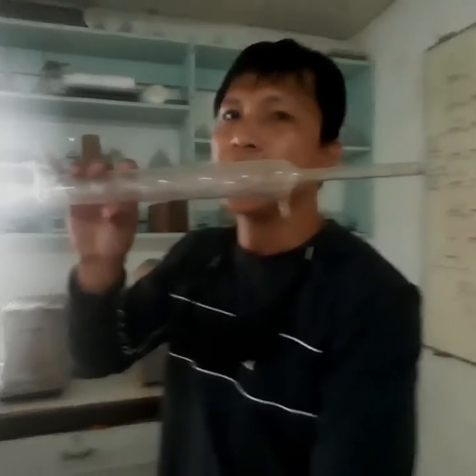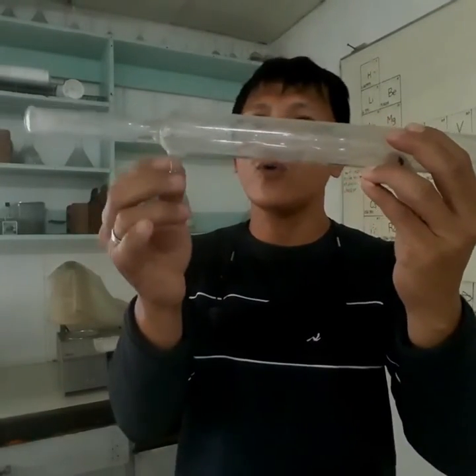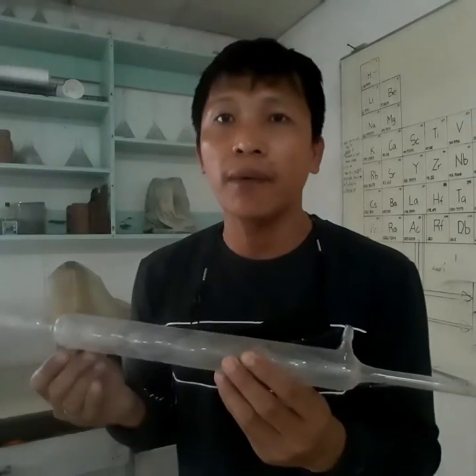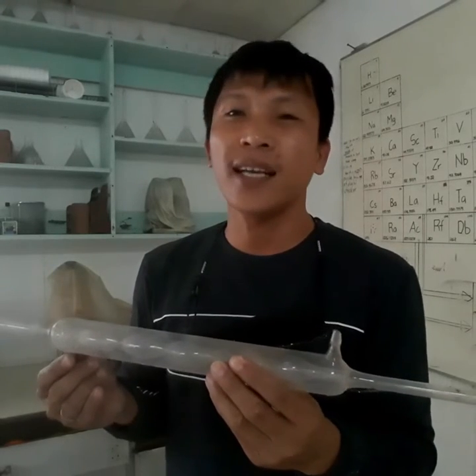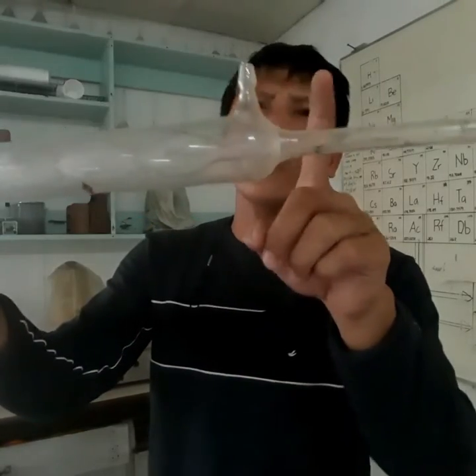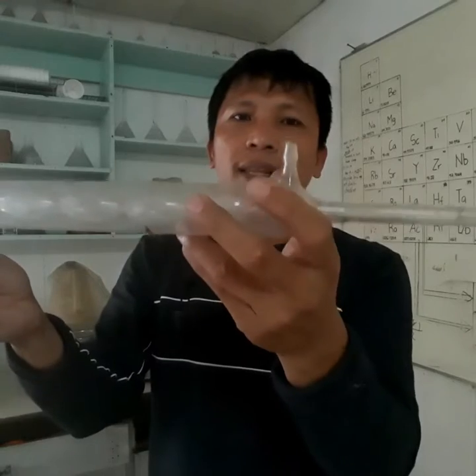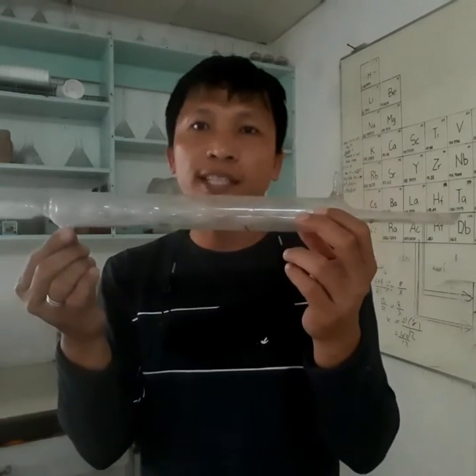of your condenser, as you can see, you have two holes here. You have a hole here. As you can see, there's a glass protruding here, wherein you can attach a pipe or, no, not a glass tube, but a rubber tube. This is actually the inlet, and then you have the outlet part. This part here uses water as your coolant.